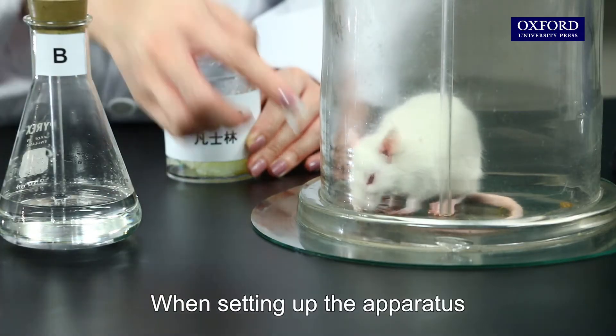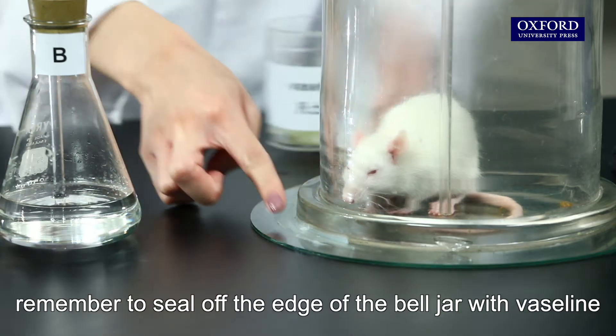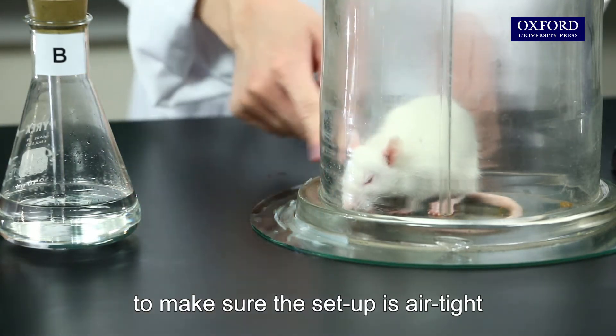When setting up the apparatus, remember to seal off the edge of the bell jar with Vaseline to make sure the setup is airtight.